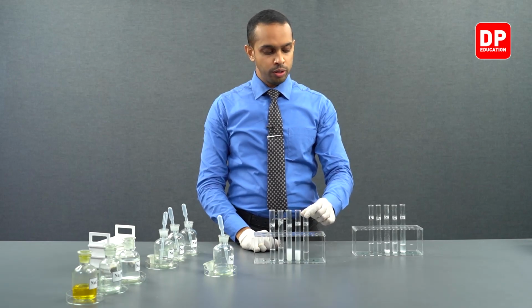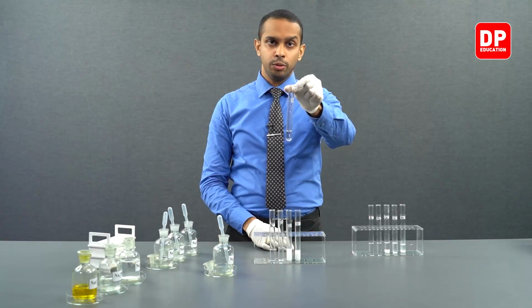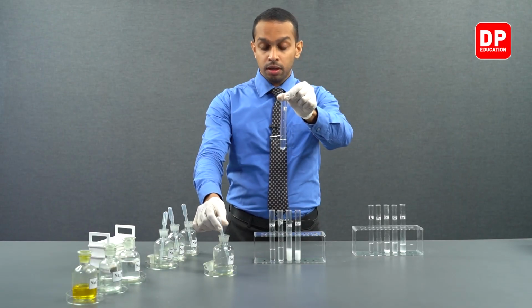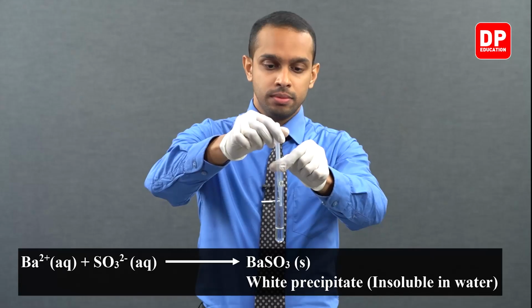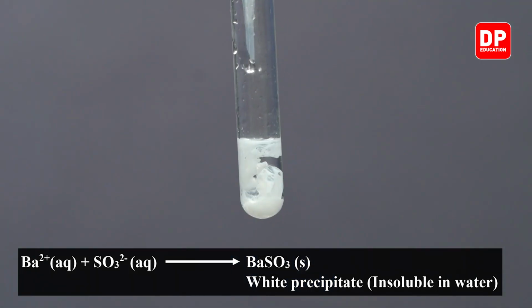Now we move on to our barium 2+ aqueous ion solution. Let's add a small amount of sodium sulfite.